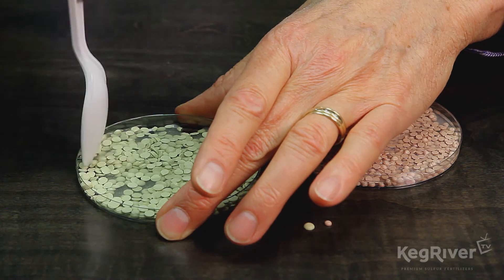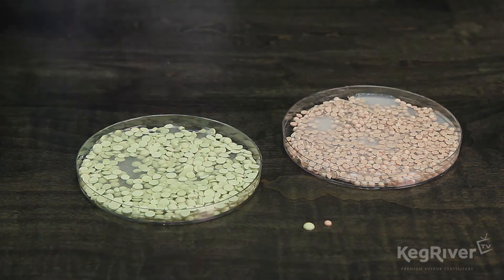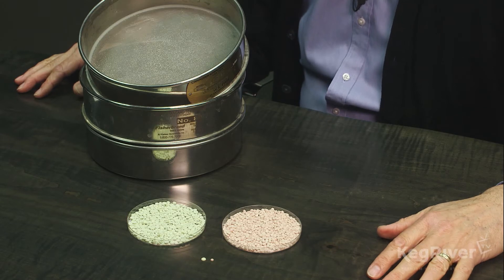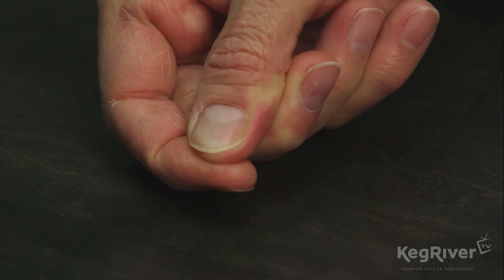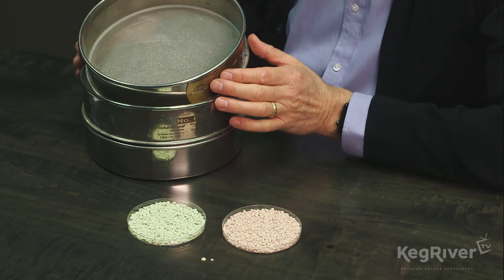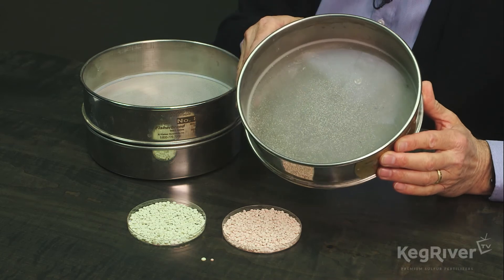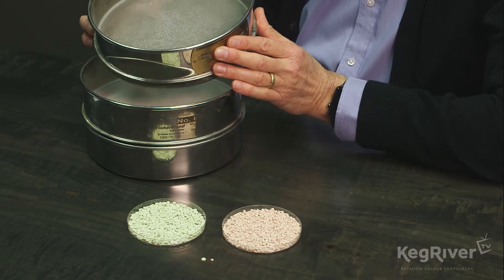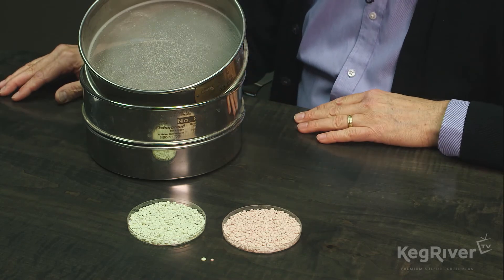Let the water fully activate the clay in the product just like so. After 24 hours, the samples are both fully degraded and dried, and then the next stage is to run them through the 60 mesh screen and the 80 mesh screen in order to separate the size fractions.